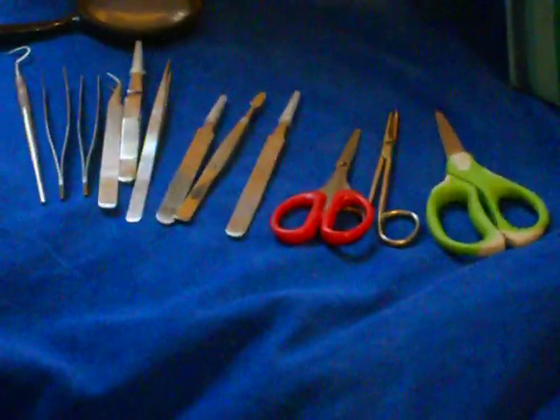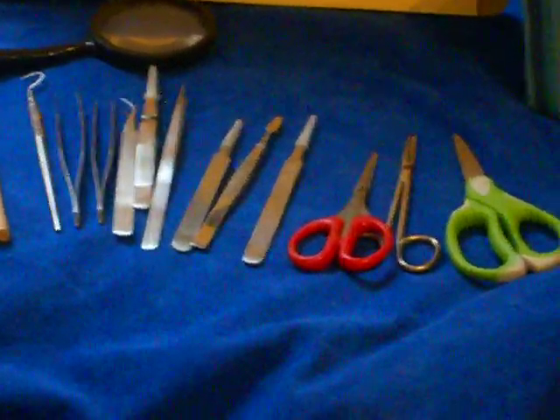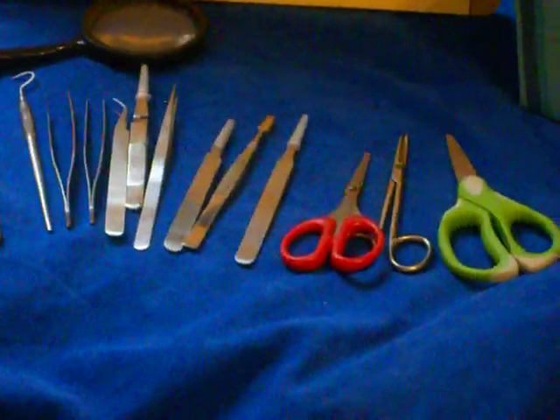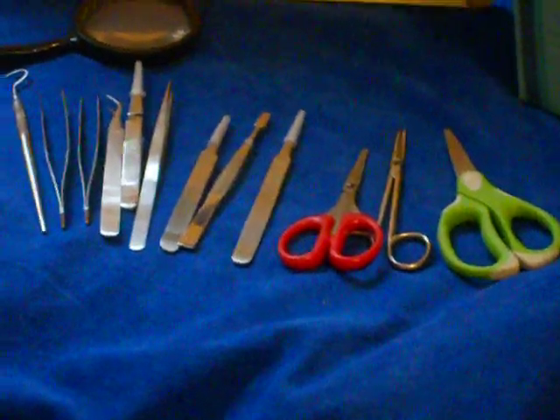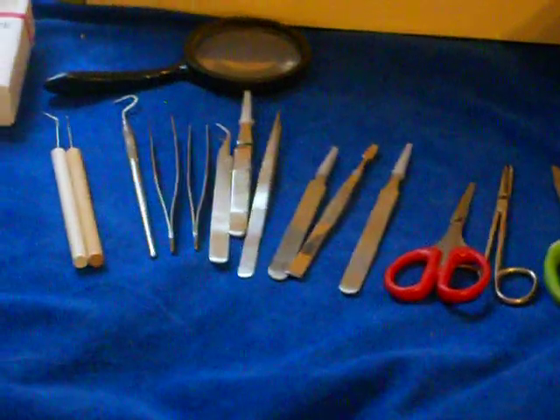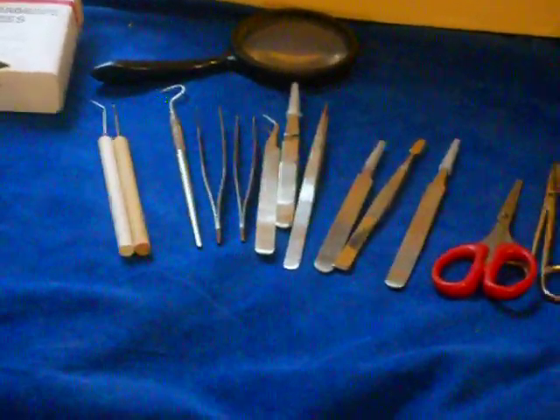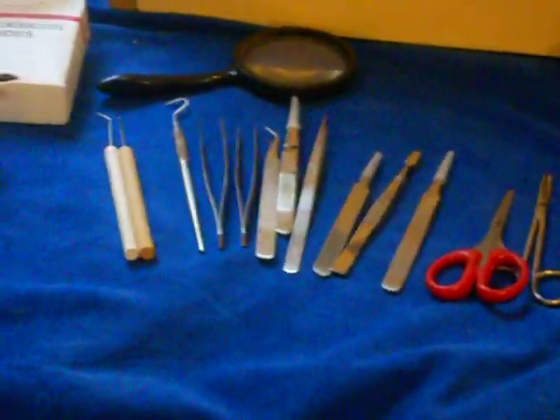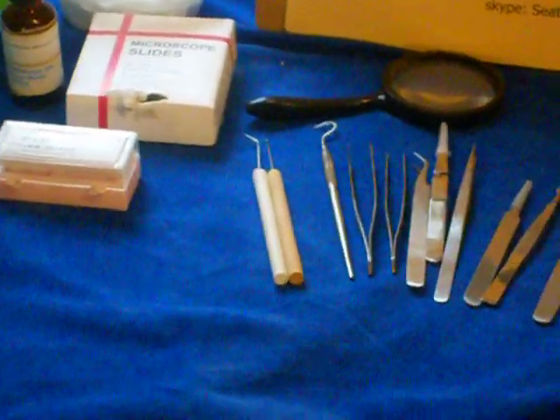What you're looking at here are what I use as tools to snip plant parts, pluck them out of a larger sample. On the right you see a selection of small scissors. In the middle you see a selection of tweezers, many different types of tweezers, and there are actually stores and outlets via the internet that sell exclusively tweezers. So just get a set. Then I've got a few other things there, pickers and the like.